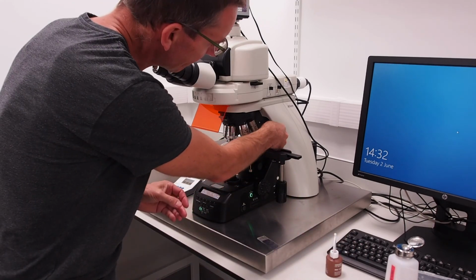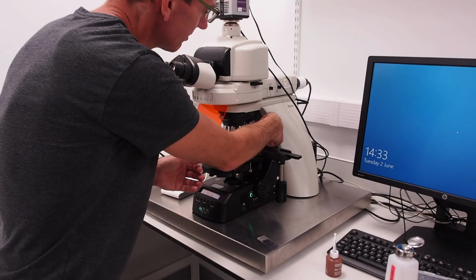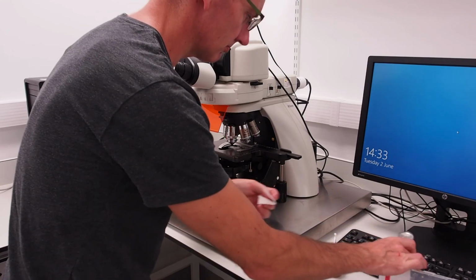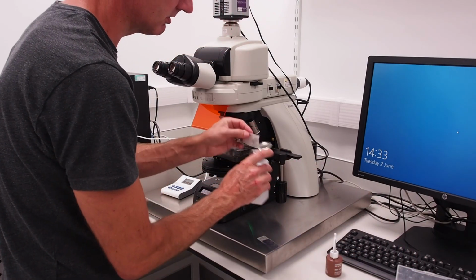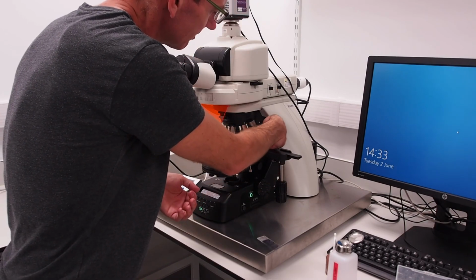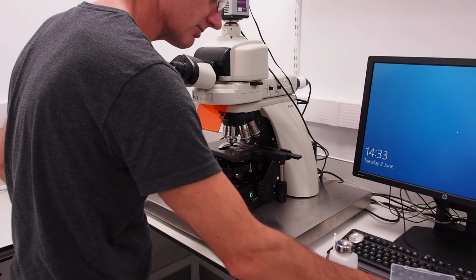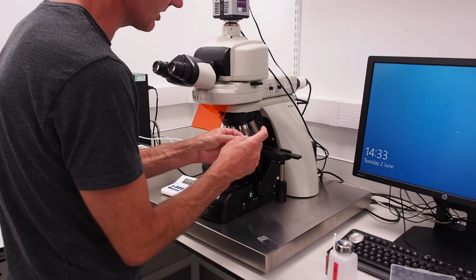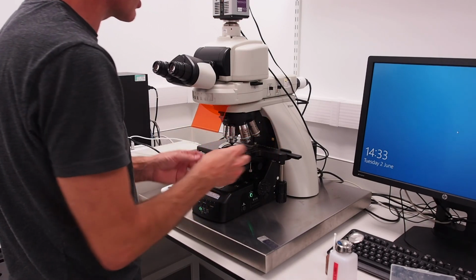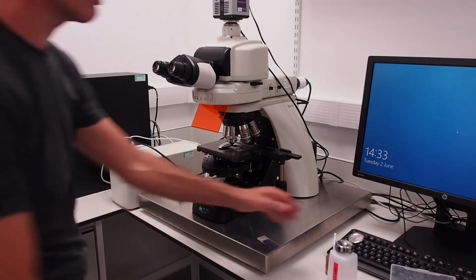For the oil immersion lens, take a single piece of lens tissue from the box and fold it in half. Use this to carefully wipe across the objective lens to remove excess oil. Using a fresh piece of lens tissue, wet it with alcohol from the supplied bottle and once again wipe the objective lens to remove any residual oil. Finally, take a clean, dry piece of lens tissue, fold it in half and wipe the lens to remove any alcohol residue. If there are any spillages on the microscope stage, also wipe these up.